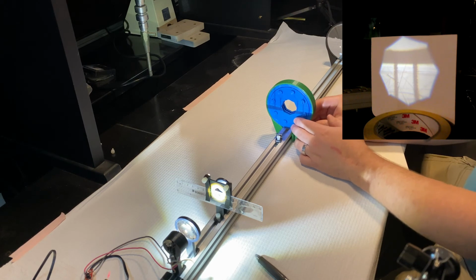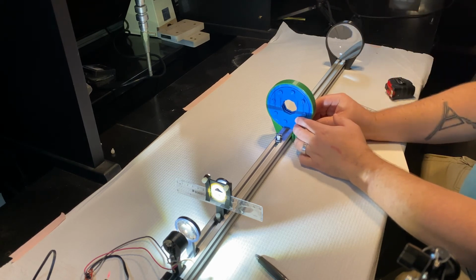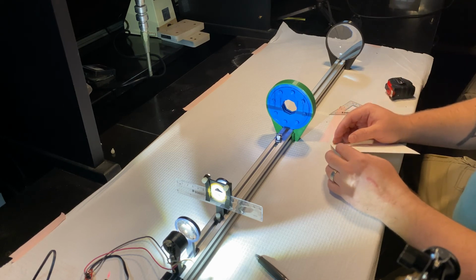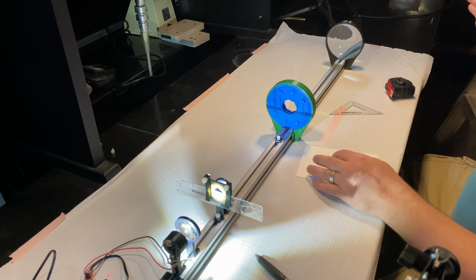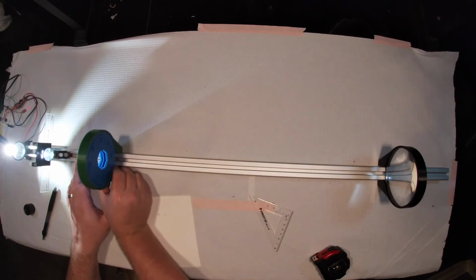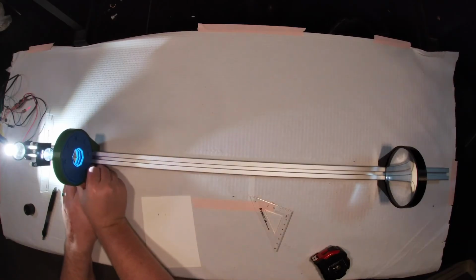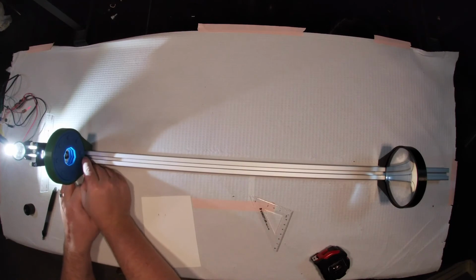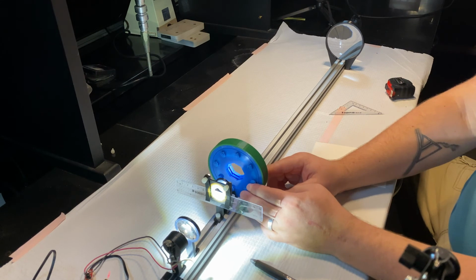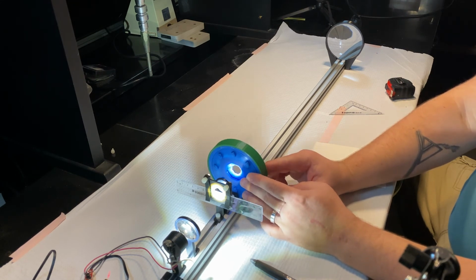All right, so we know how an iris placed at this conjugate image plane affects the image downstream. Let's look at what would happen if I moved my iris a lot closer to my objective, and then we'll play with this.